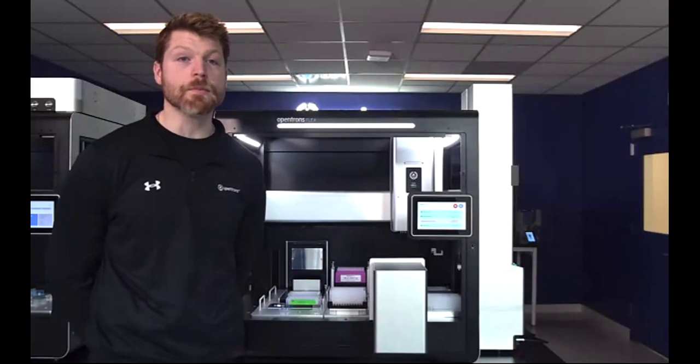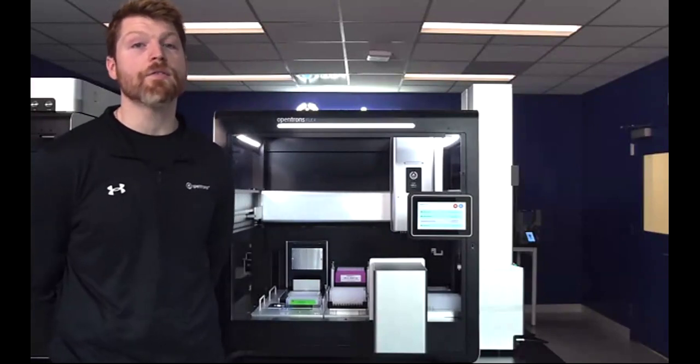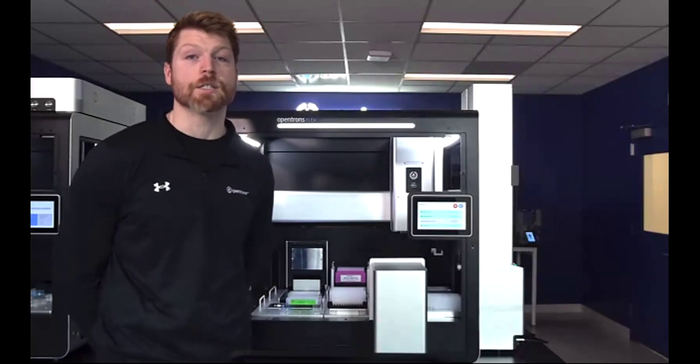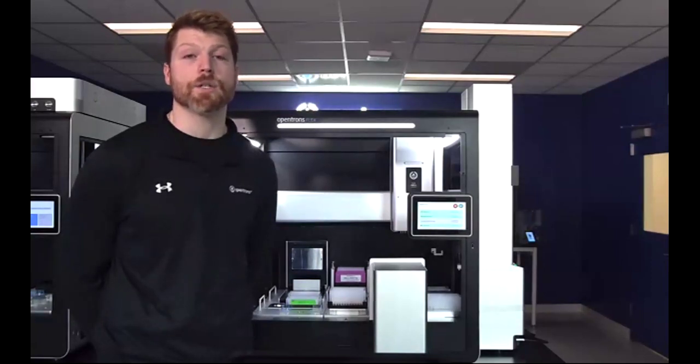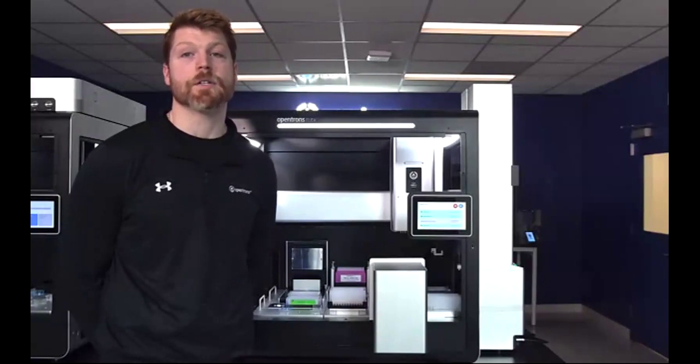So now I'm going to go over a few key features of the Flex high throughput NGS workstation, and also run a short demo so you can see it in action. We'll take all questions at the end, but please feel free to type them into the Q&A box at any time, and we'll ensure that we get to all of them. If there are any questions that we don't have time to answer, if you are registered with your email, we can always reach back out to you afterwards and track that information down. And as a last resort, always feel free to reach out to your Opentrons local rep. They are also a wealth of knowledge for you.